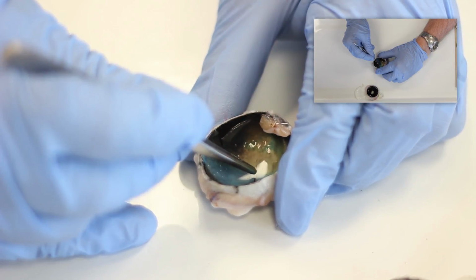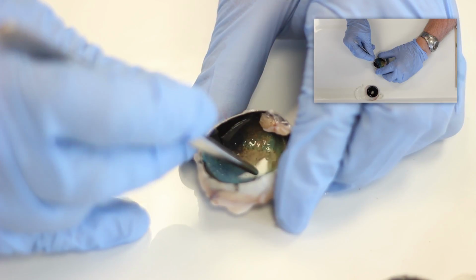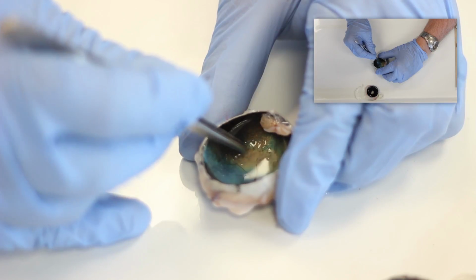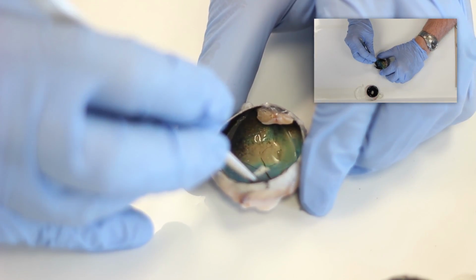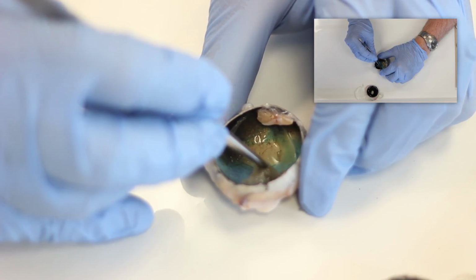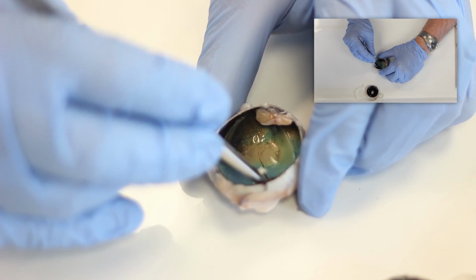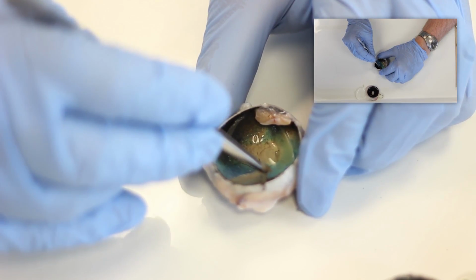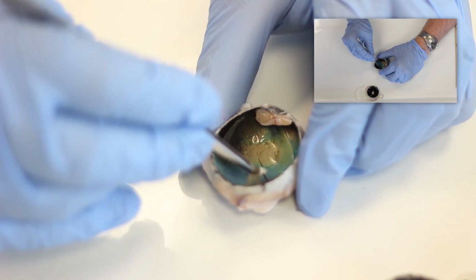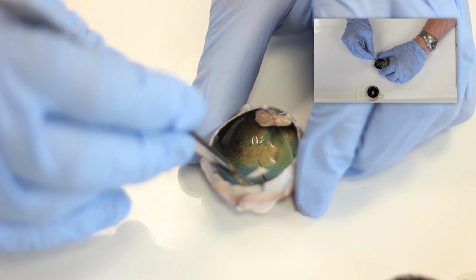These blood vessels are seen with an ophthalmoscope, and they supply nutrients and oxygen to the nervous coating of the eyeball, the retina. You can take your forceps and lift the neural retina from the underlying pigmented vascular layer, the choroid. Moving the retina away from its association with the pigmented epithelium and the choroid would be a retinal detachment.